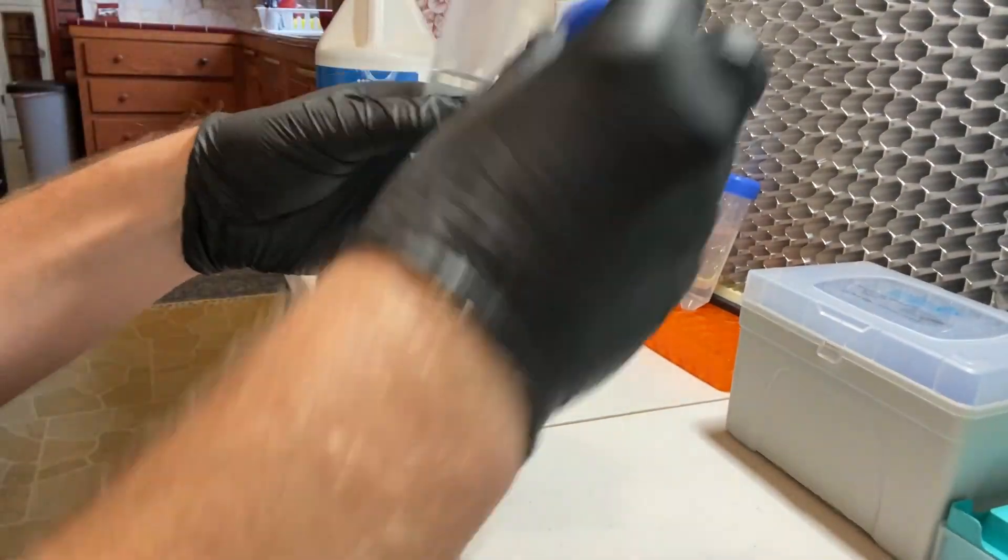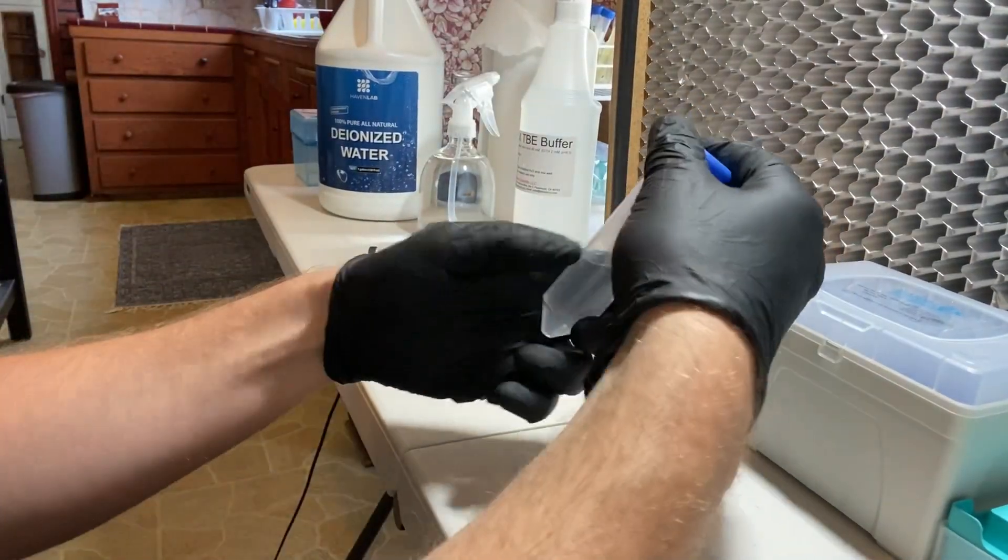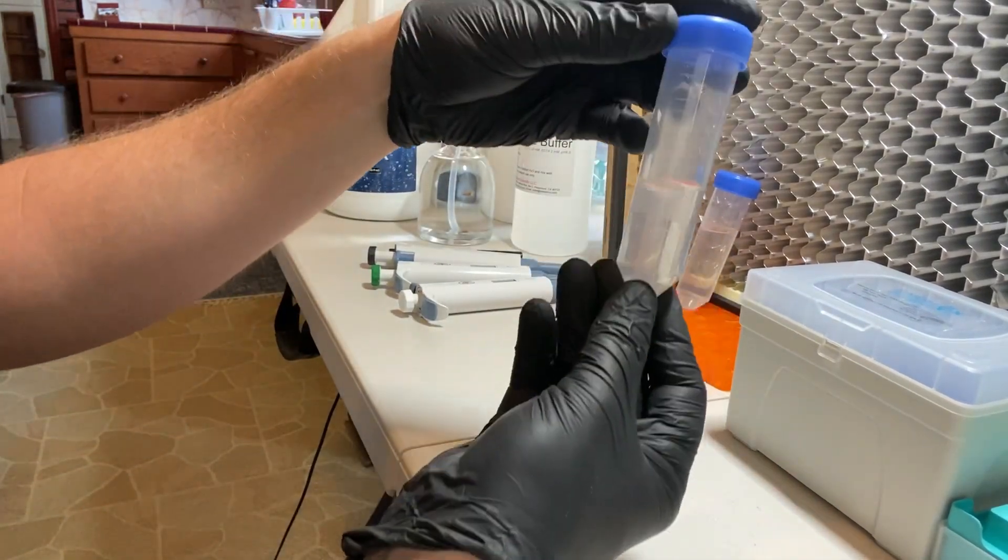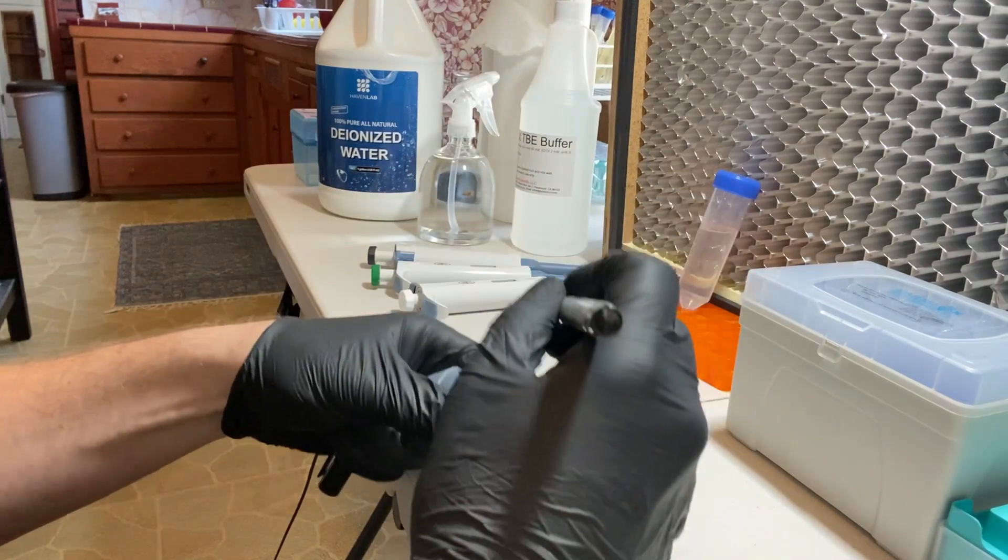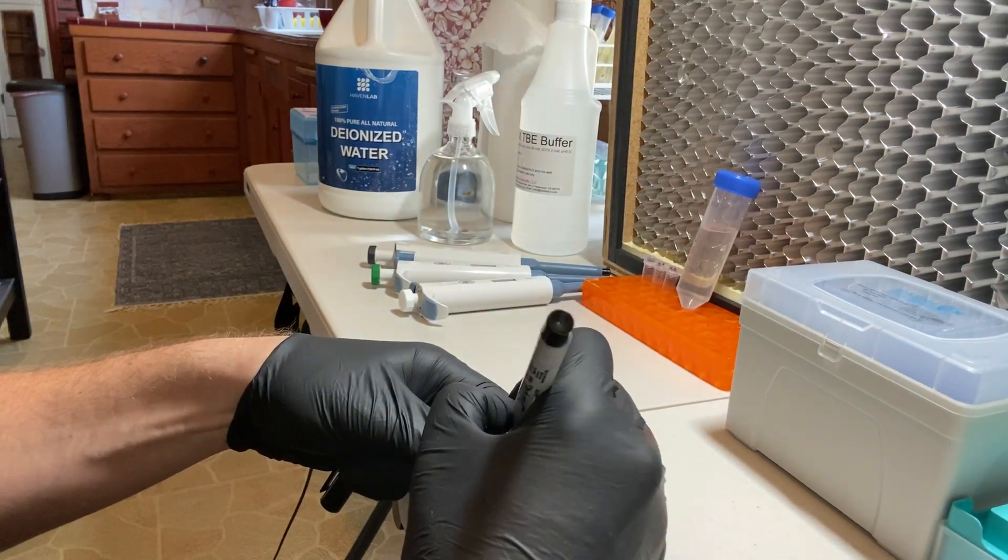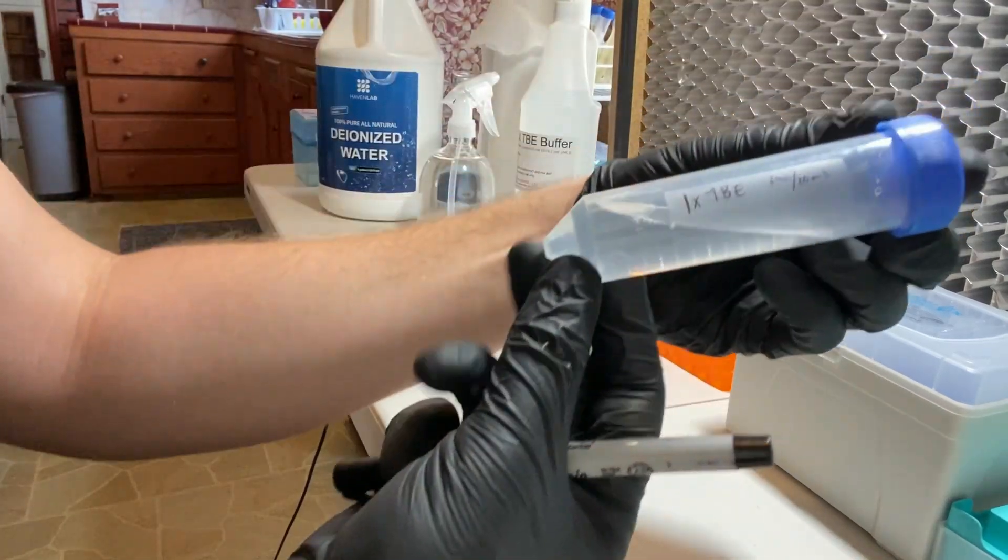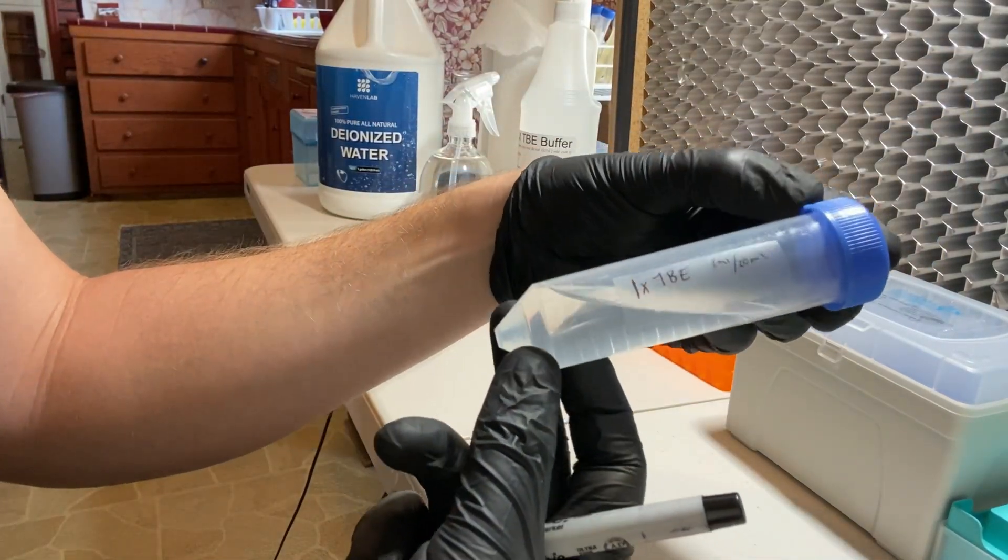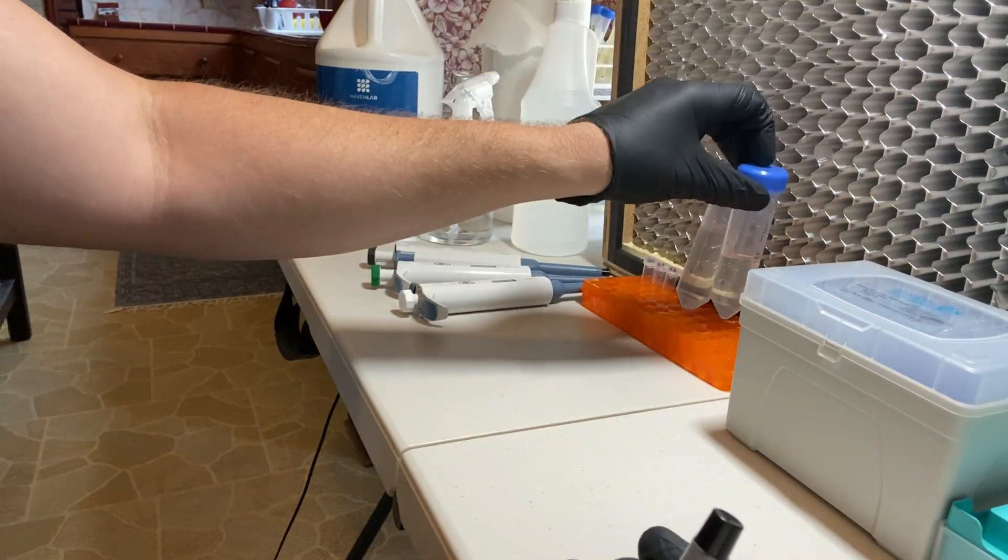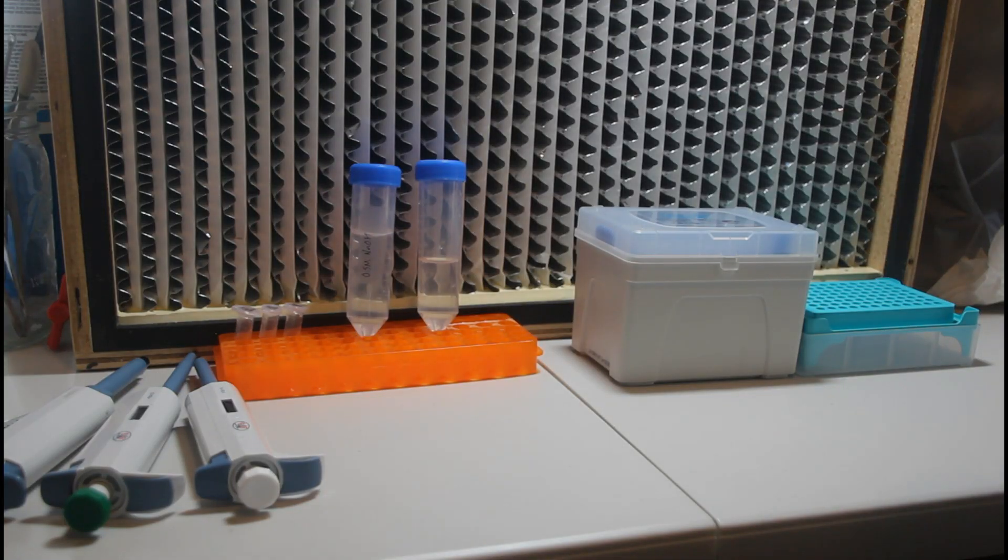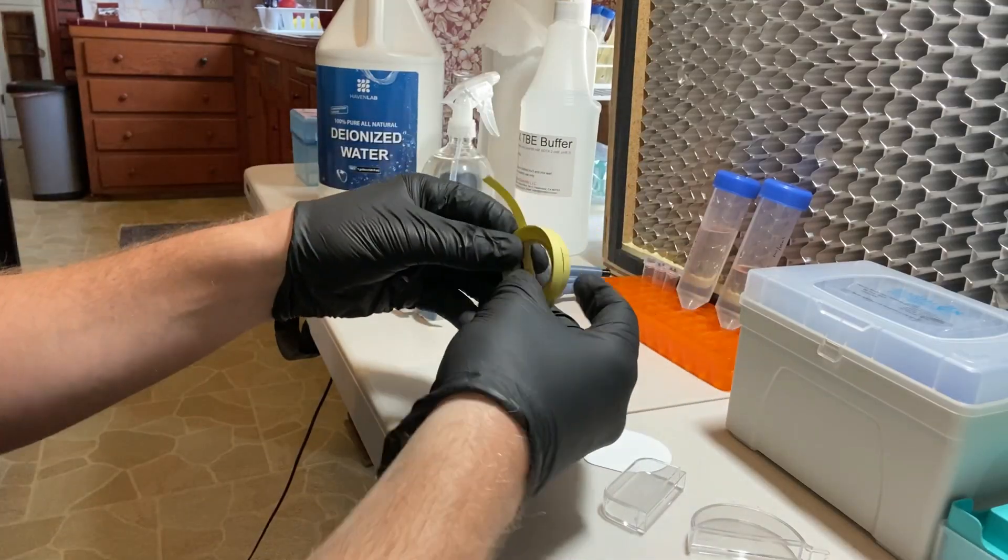TBE stands for Tris Borate EDTA. The lower the temperature, the more likely the borate will inevitably fall out of solution. So make sure that before you use your TBE buffer stock solutions that you double check that they're thoroughly mixed. And if not, you can always pop the TBE into the microwave for about 4 to 6 minutes to re-dissolve the borate.